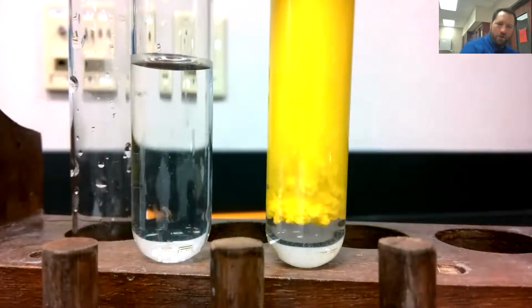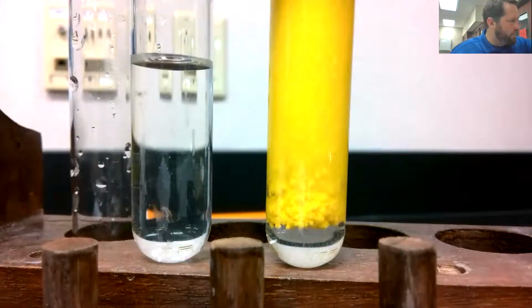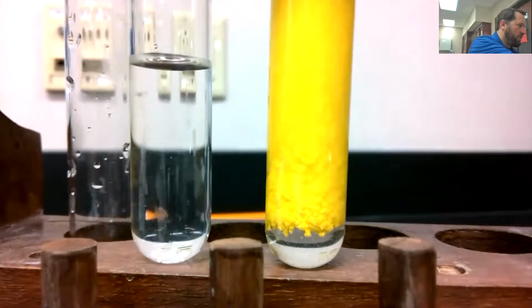That's actually really cool. Cool image you get to see there. That's awesome. I've never actually seen it do this much. So that's a precipitate forming. Again, the whole thing didn't just turn solid. It's still liquid, but you can see little particles of yellow solid in there. I'm impressed. I thought that was awesome. Sorry you guys weren't able to see it yourself.